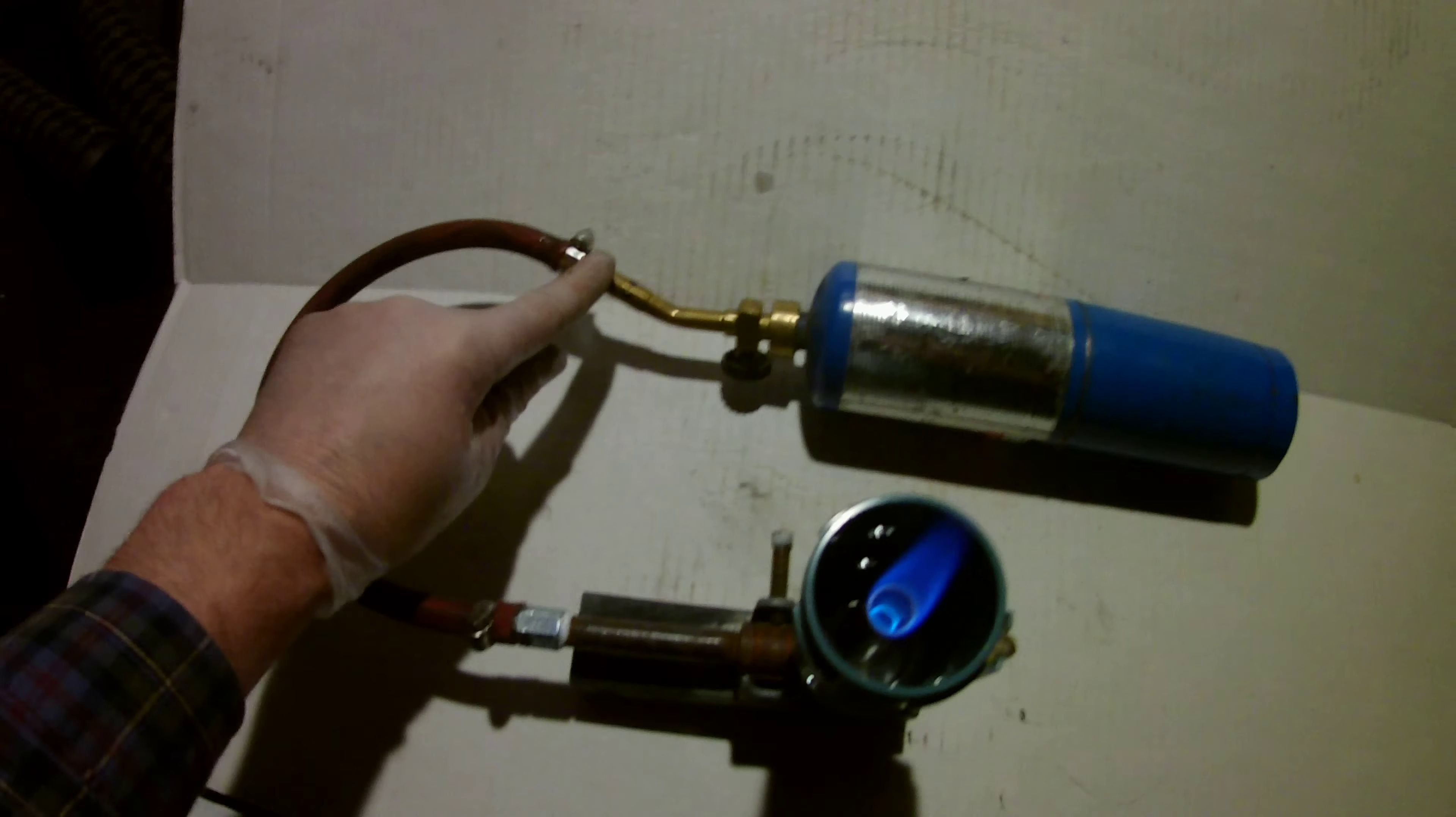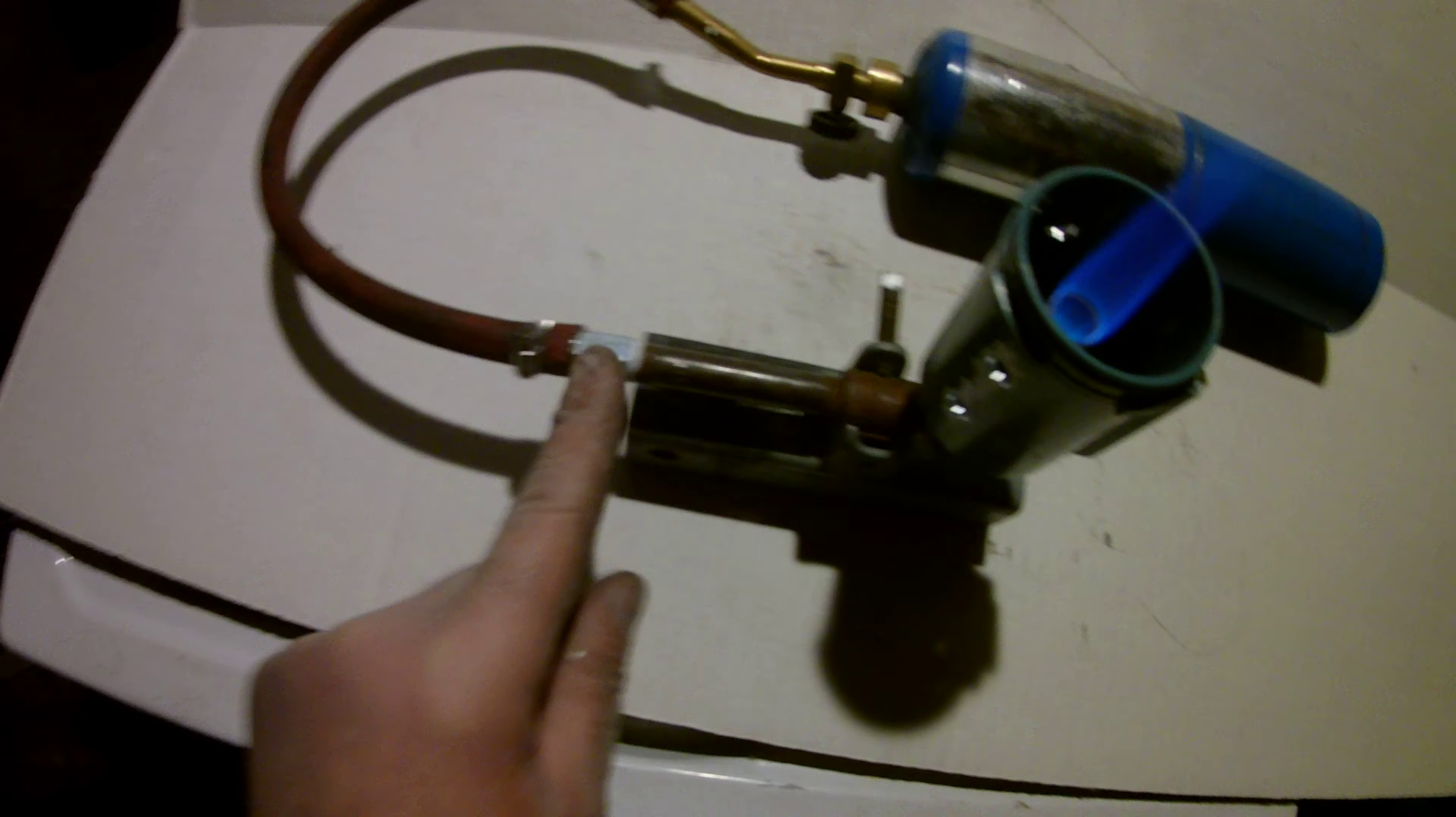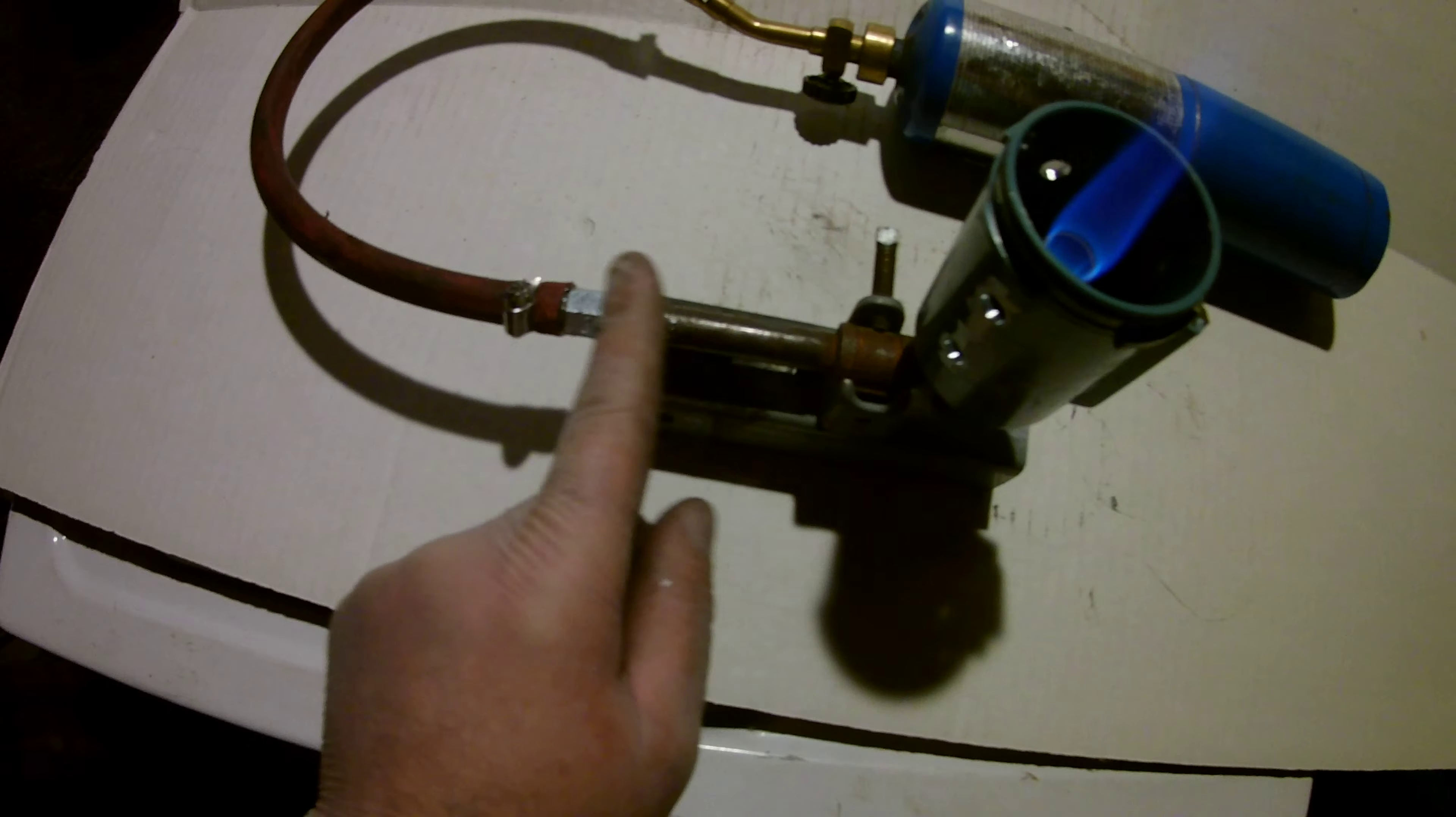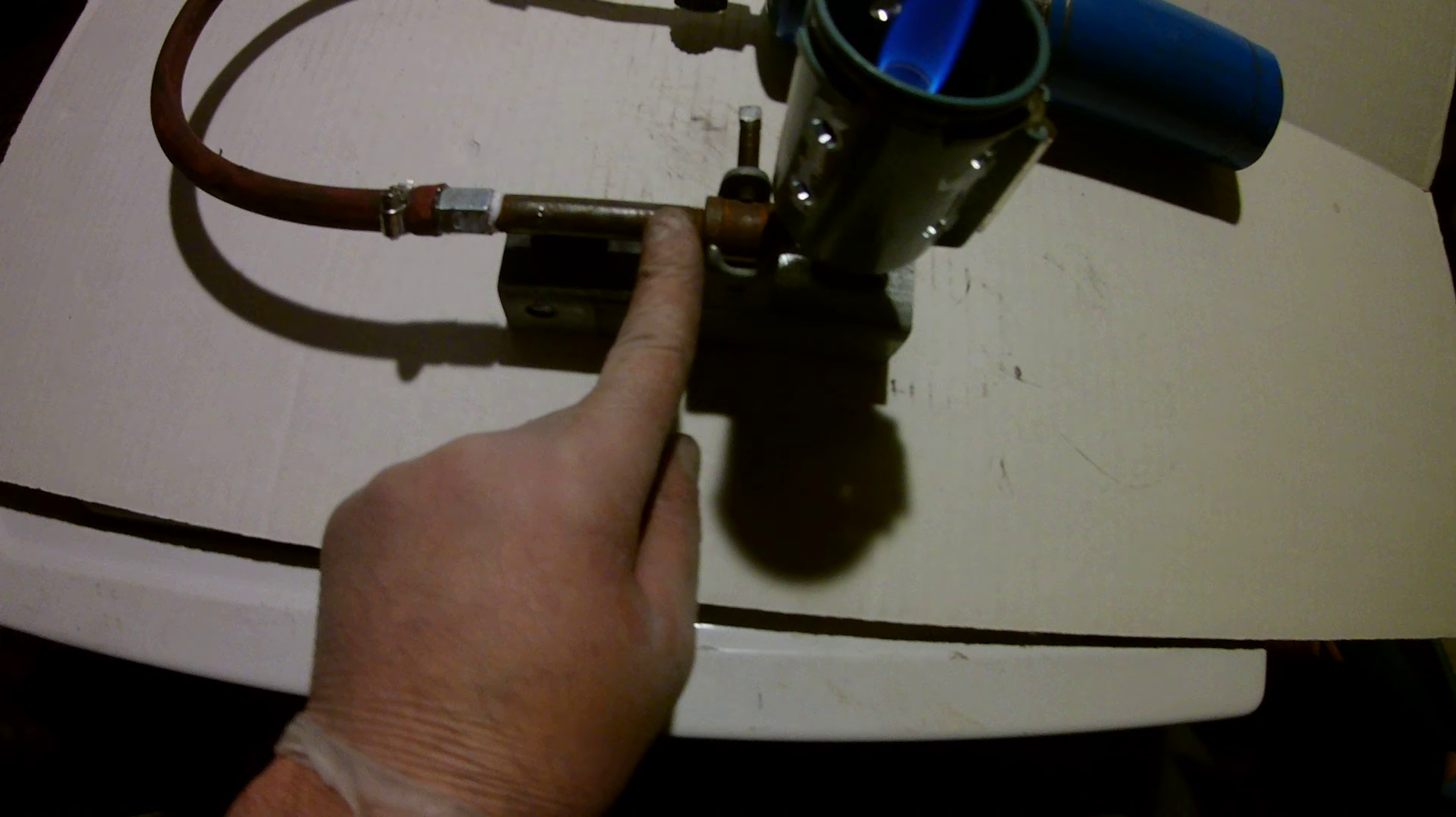I've used an airline hose that I've sealed in with marine grade glue, and I've clamped it. And on the Bunsen burner itself, I've just used the male end of an air coupling, going to black pipe.